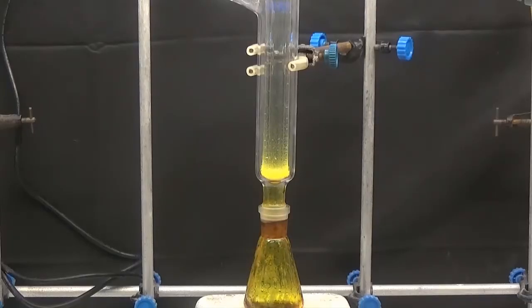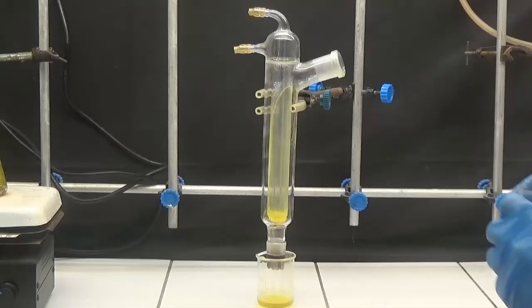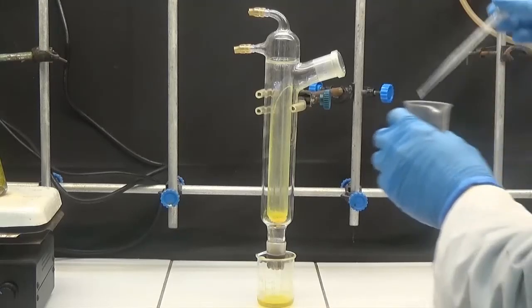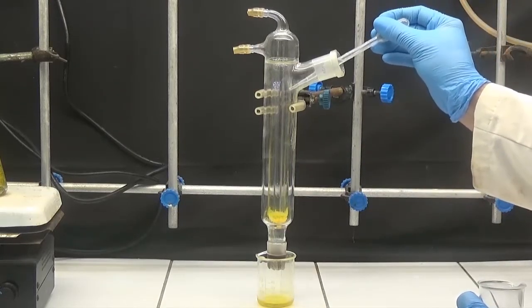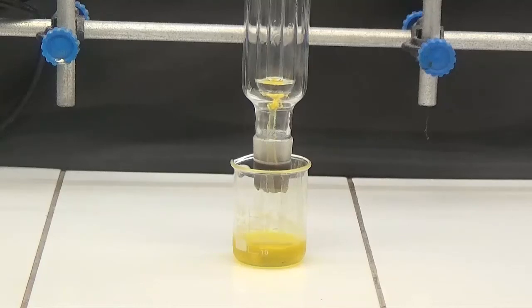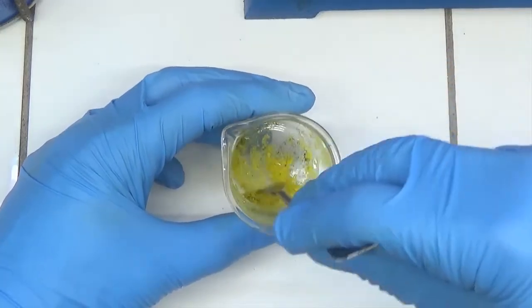Dissolve the benzoquinone crystals that formed in the condenser using ether. Evaporate the ether to obtain the benzoquinone pure.